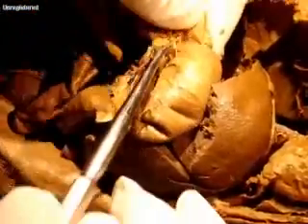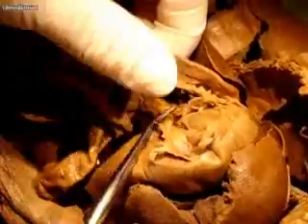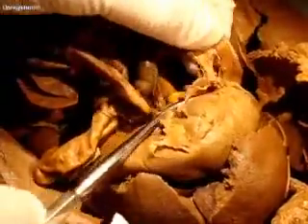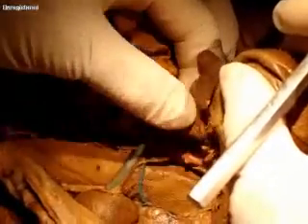Now you have the continuation of the small intestine — the stomach going into the small intestine and the duodenum. And then all in here, pretty torn up but you can see there's some glandular tissue — this is all pancreas in here. The spleen is very small. This is the spleen right here. There's more pancreas right there. Can you see that little tiny spleen? It's like a boomerang.